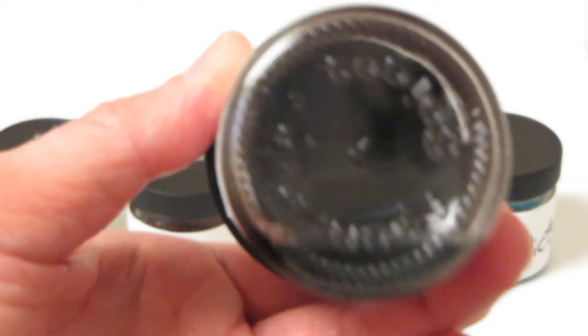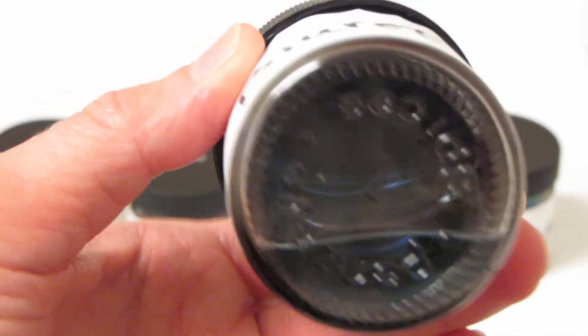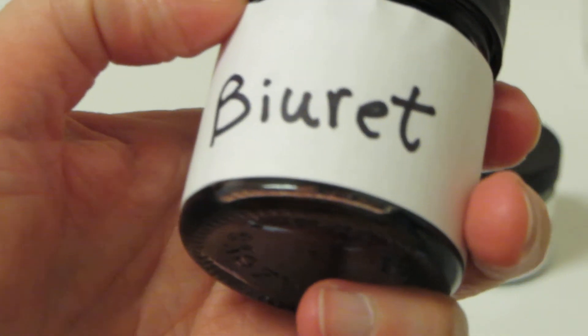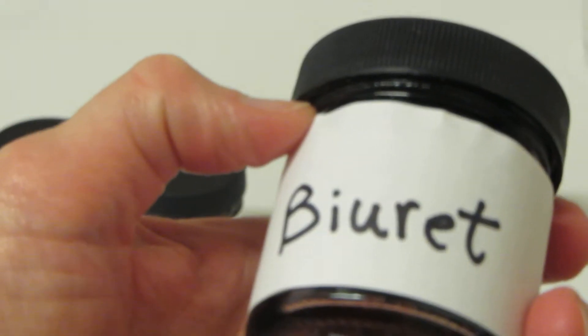Biuret solution is blue — sort of a gray-blue color. This one is used to identify proteins.